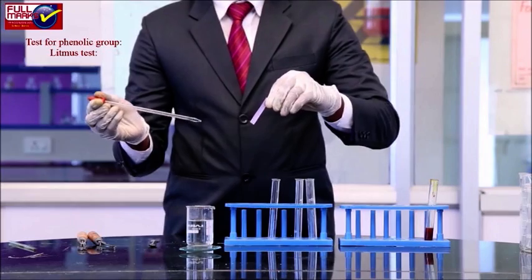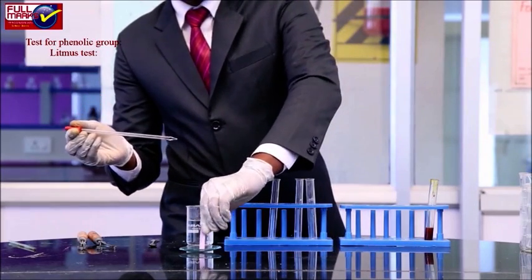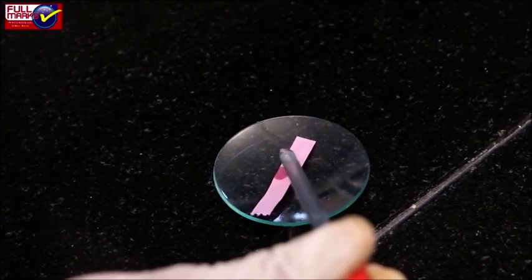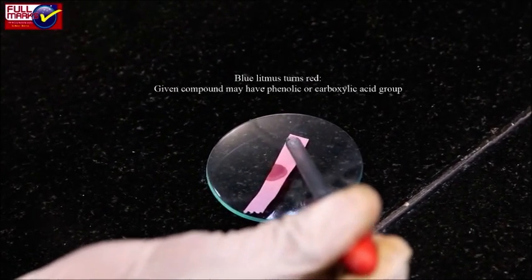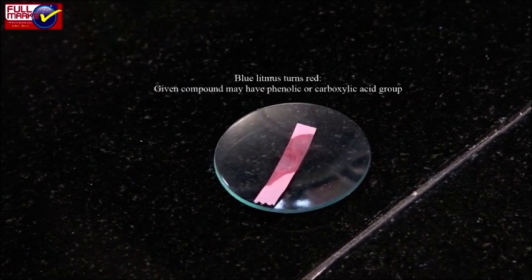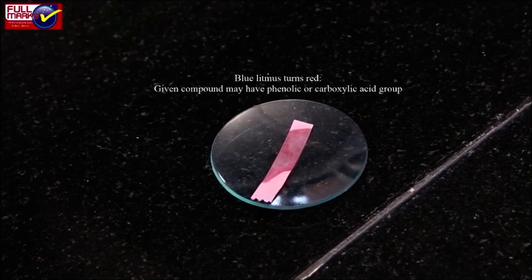Test for phenolic group. Litmus test. Put 1 drop of organic compound on a blue litmus paper. We observe that blue litmus turns red. So, the given compound may have a phenolic or carboxylic acid group.